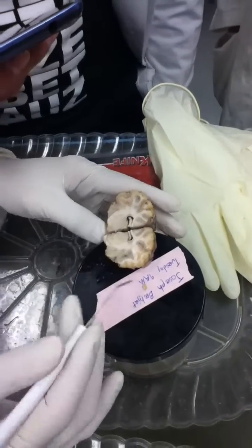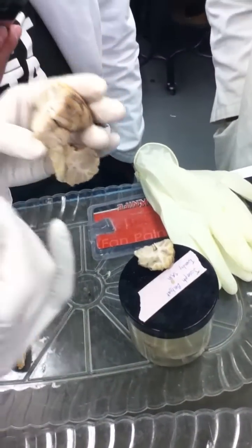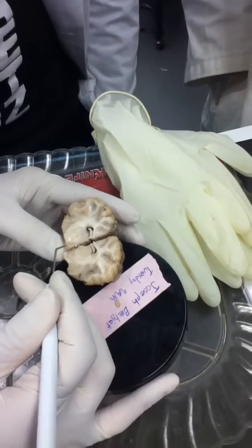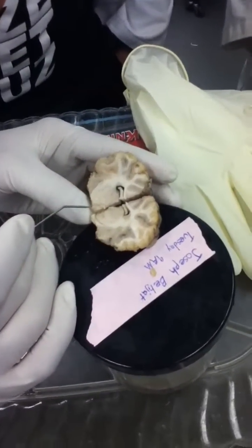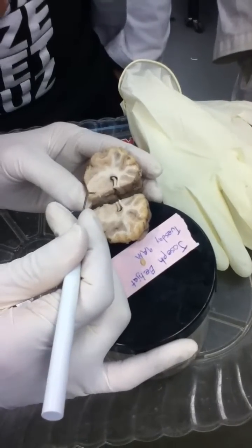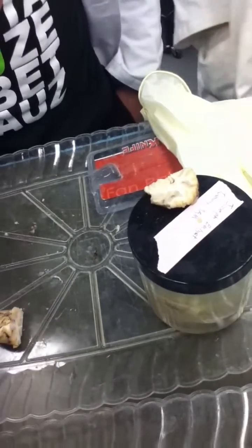And we actually see, this is really hard to see. I was just looking for a better one, but this is, hang on. It's kind of there. You can see a white streak here. Can you see that white streak here? Like right here, it's faint, but it's a white streak. And on top of it, there's a very, very faint white dot up there. I wish it was clearer, but it's actually not very clear at all.